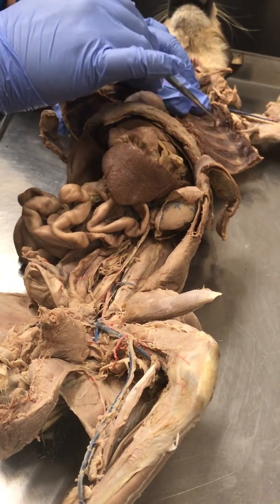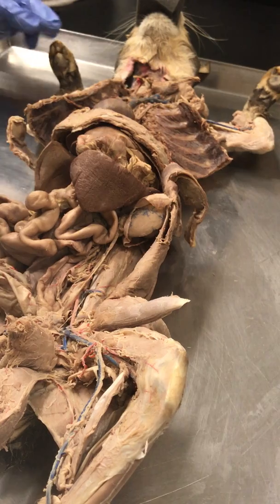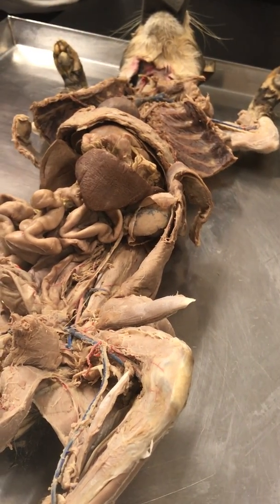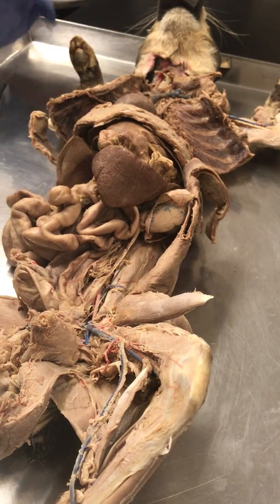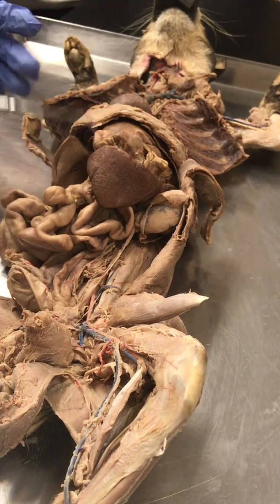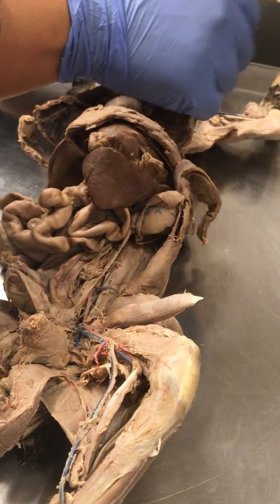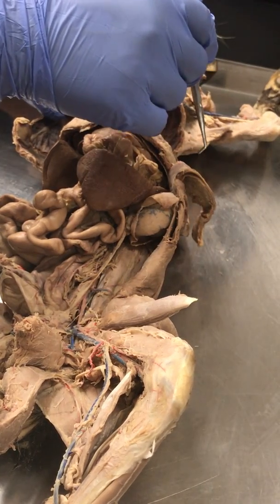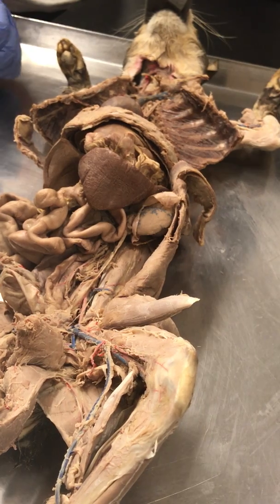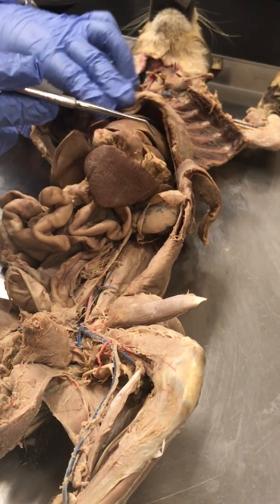Remember that there are muscles in between the ribs, the intercostal muscles, and these muscles also help expand the ribs. We have some muscles that will attach to the first ribs, known as the scalene muscles. They will also help pull the ribs up as we take a breath. When we exhale, the diaphragm relaxes, so it goes back into a dome and pushes everything out. We got some muscles on the back that will attach to the ribs, known as the iliocostalis, right? And that will help tug down on the rib cage. A little more complicated, but that's good enough for you guys.